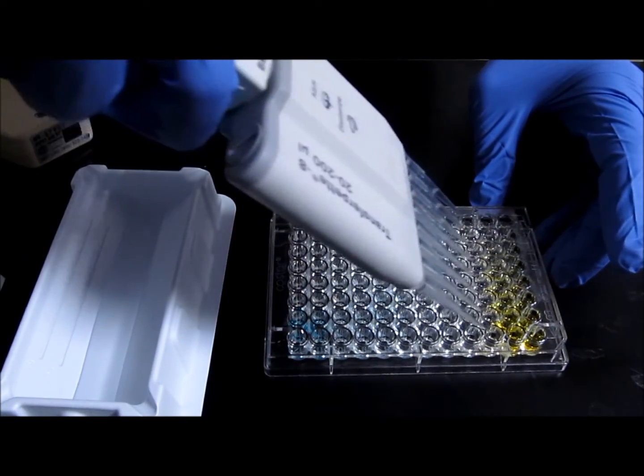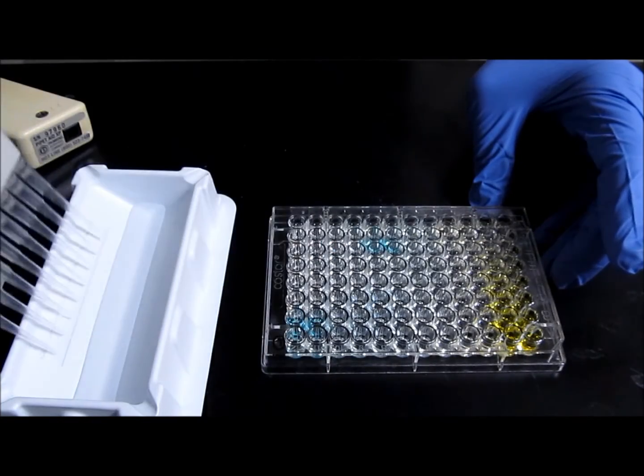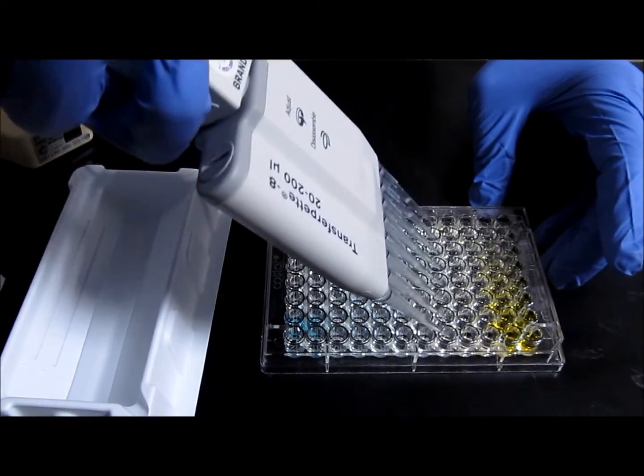As with the blue color, darker yellow indicates more of the protein of interest than lighter yellow. Read absorbance in the plate reader as soon as possible, and congratulate yourself for finishing the ELISA.